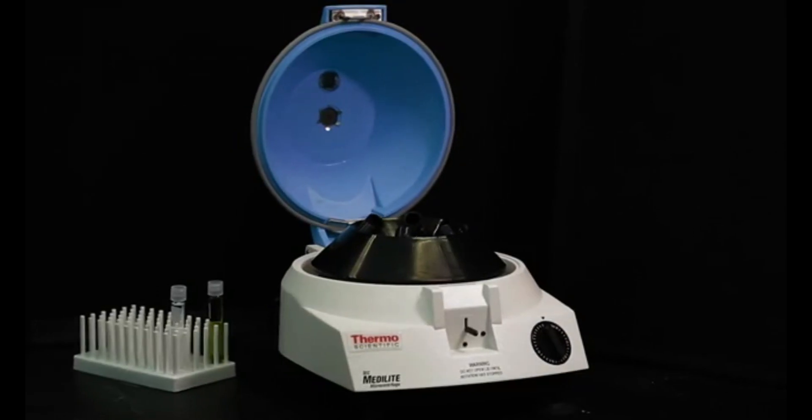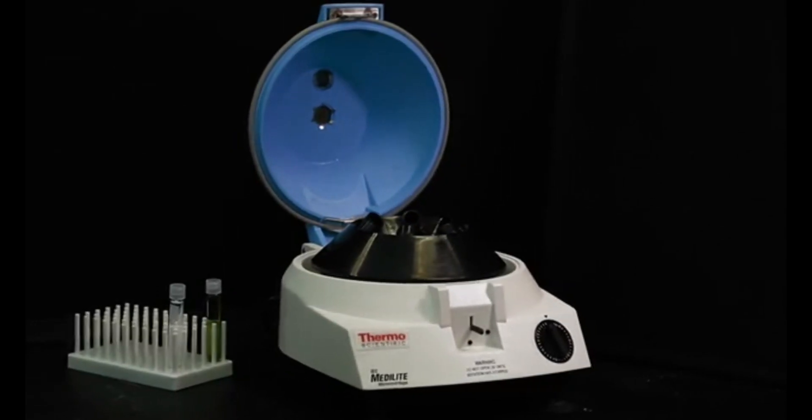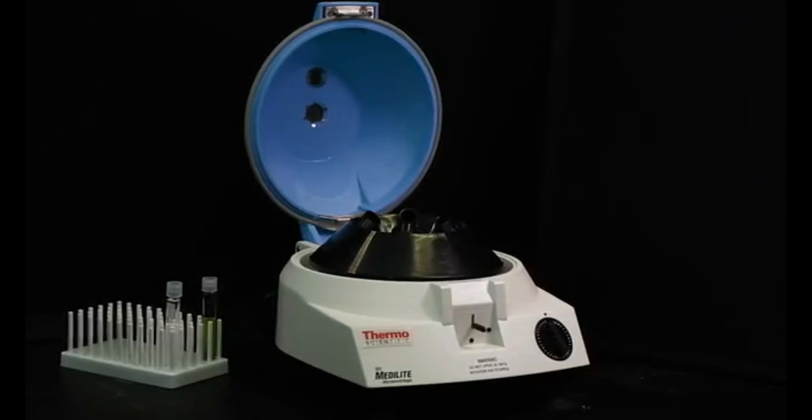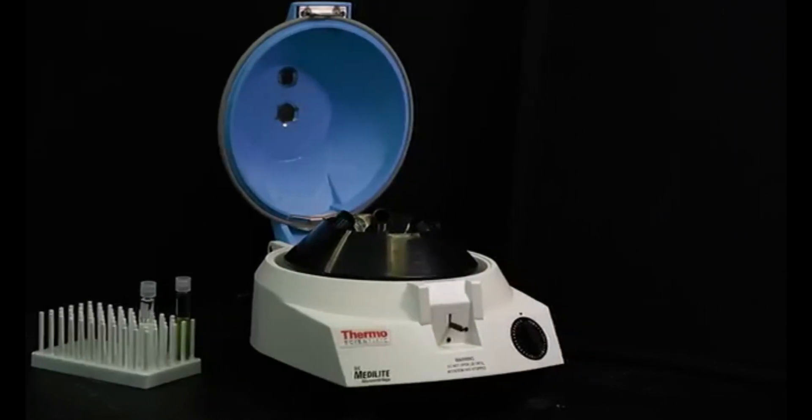Centrifuges can be used to separate immiscible liquids into layers based on density. This video demonstrates the proper use of a centrifuge.